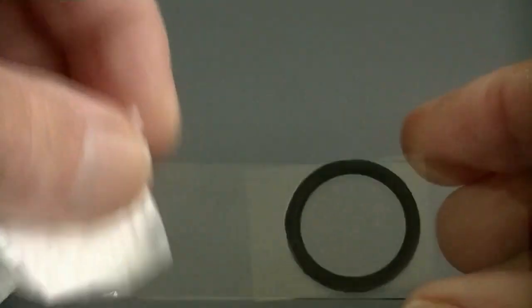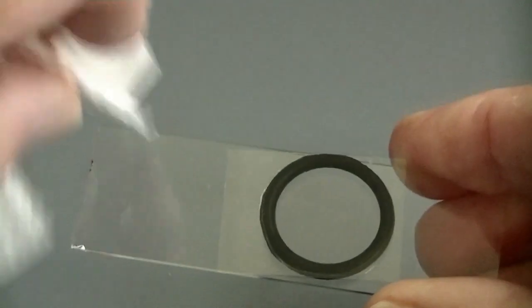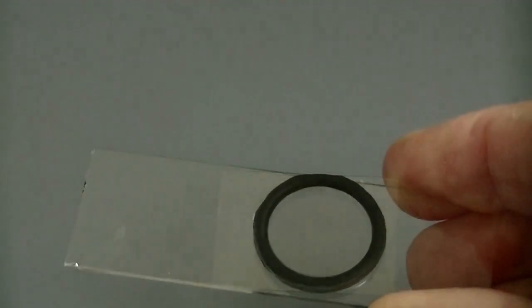Make sure there's no excess sample on the outside, particularly when dealing with sea water, you don't want the salt on the microscope stage.